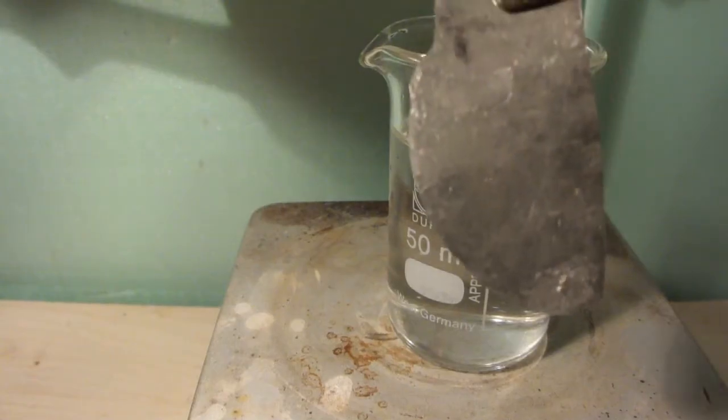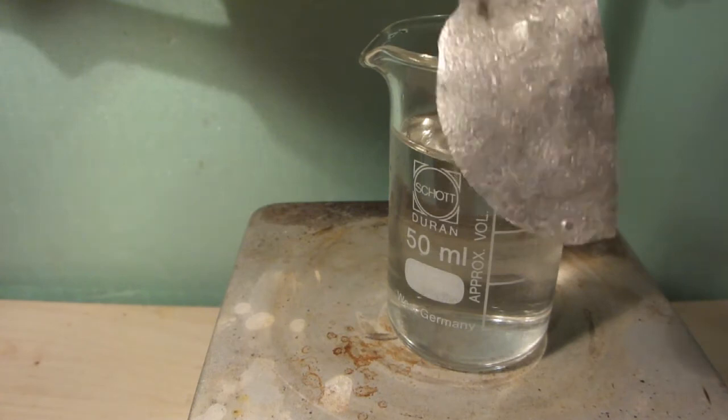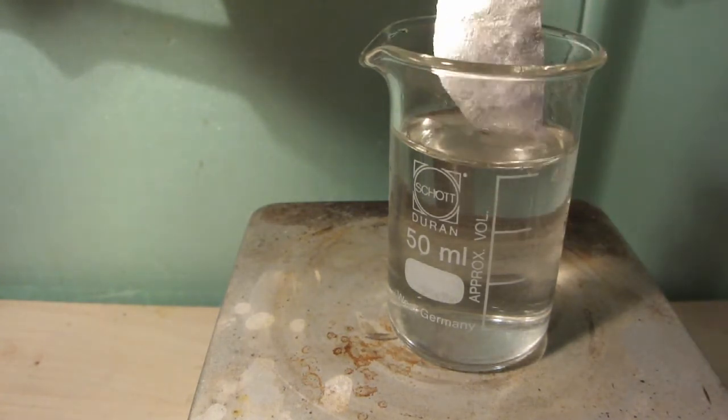Next, let's add a solid piece of forged platinum sheet. If you look carefully, you can see the forge marks on its surface.